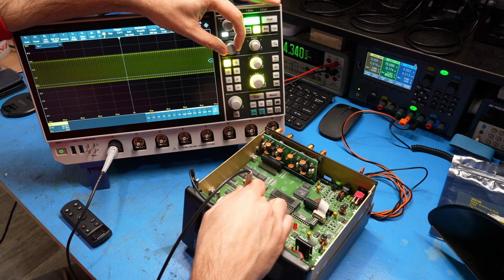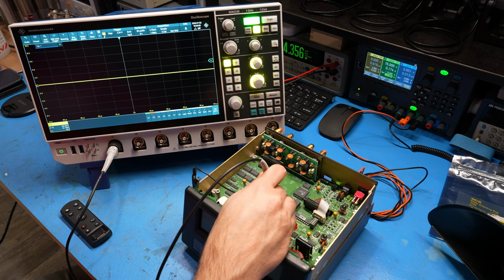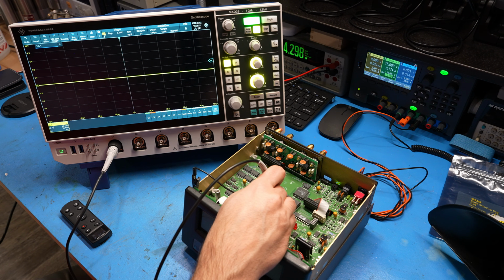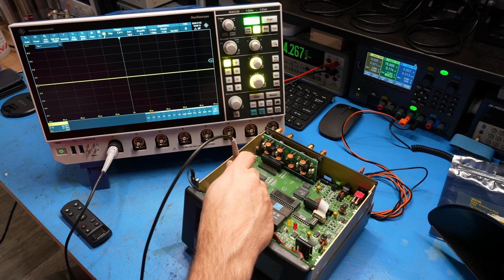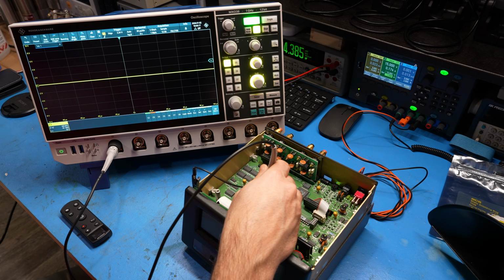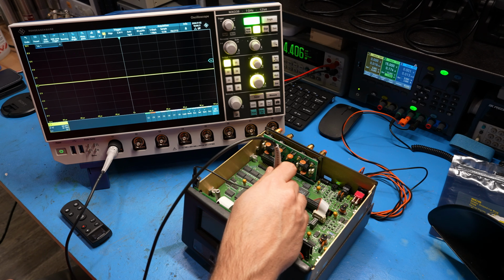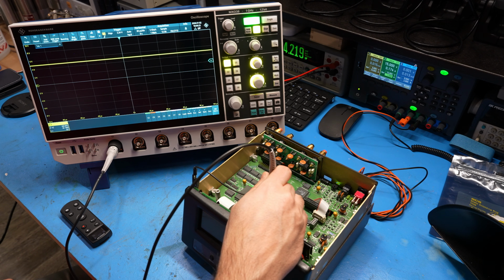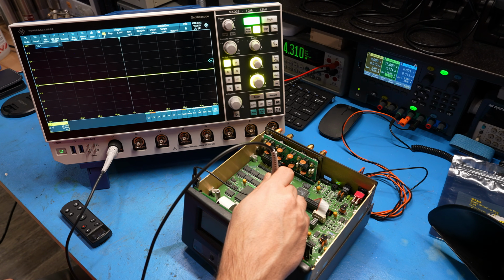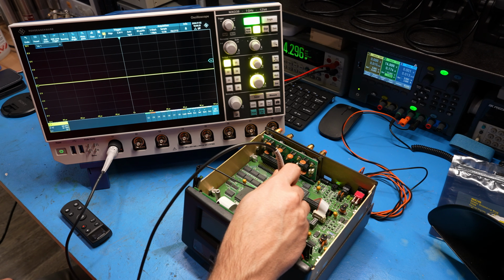Let's see if there is any activity at all on any of these pins. Let's try some of these pins here. That's high, and that is high also. Low. Let's try some of the address pins. Nope, nothing. Nothing, nothing. Nope, it's all quiet. Anything on the EEPROM? High, another high signal. Yeah, there's nothing. All right, well, that's a problem.